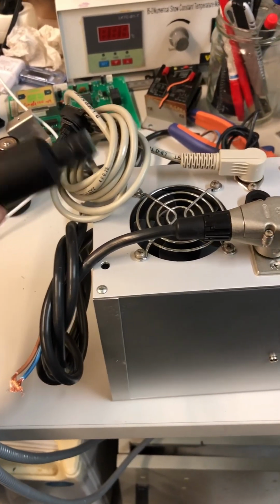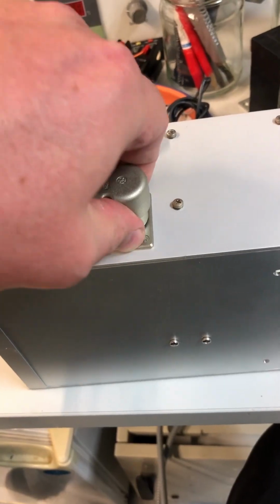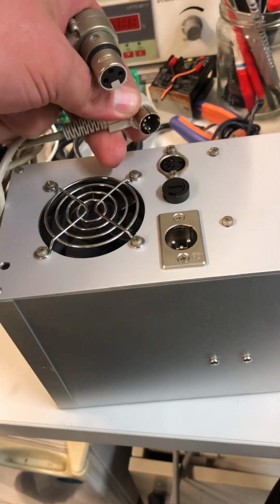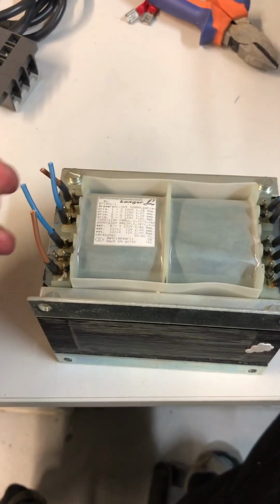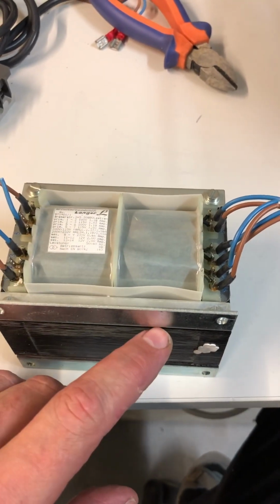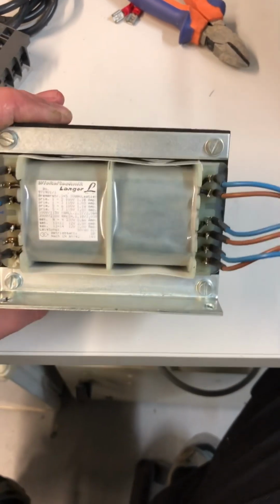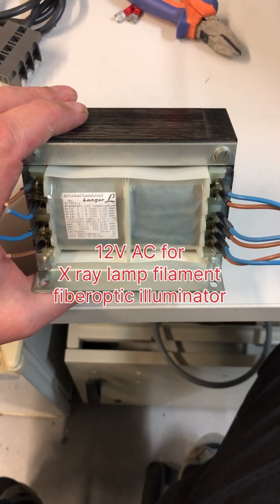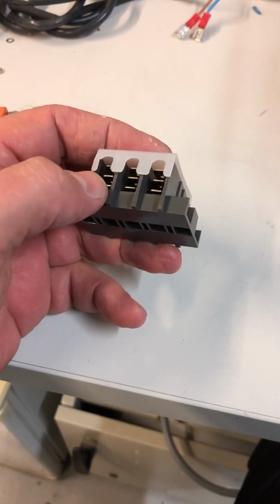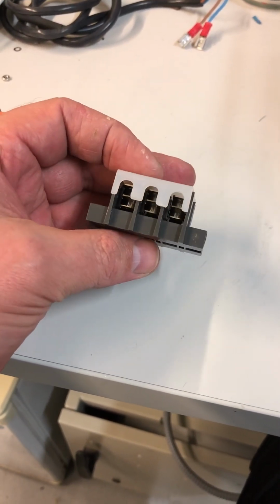Fiber bundle illumination. Here we have 12 volts AC connector and a connector for the potentiometer. The transformer has two primaries, 115 volts, which can be connected in series, and the output is 230 volts and 12 volts AC for lamp heating, for example. Trick for how to bundle AC connections: one is ground, then neutral and line, and 6 cables can be connected in parallel.